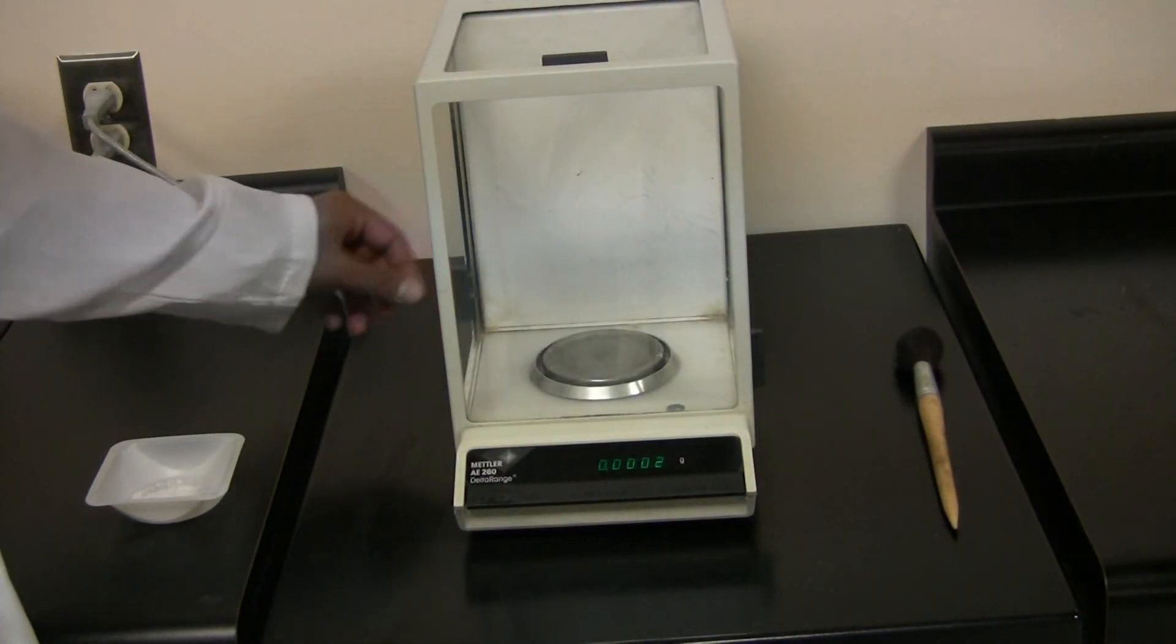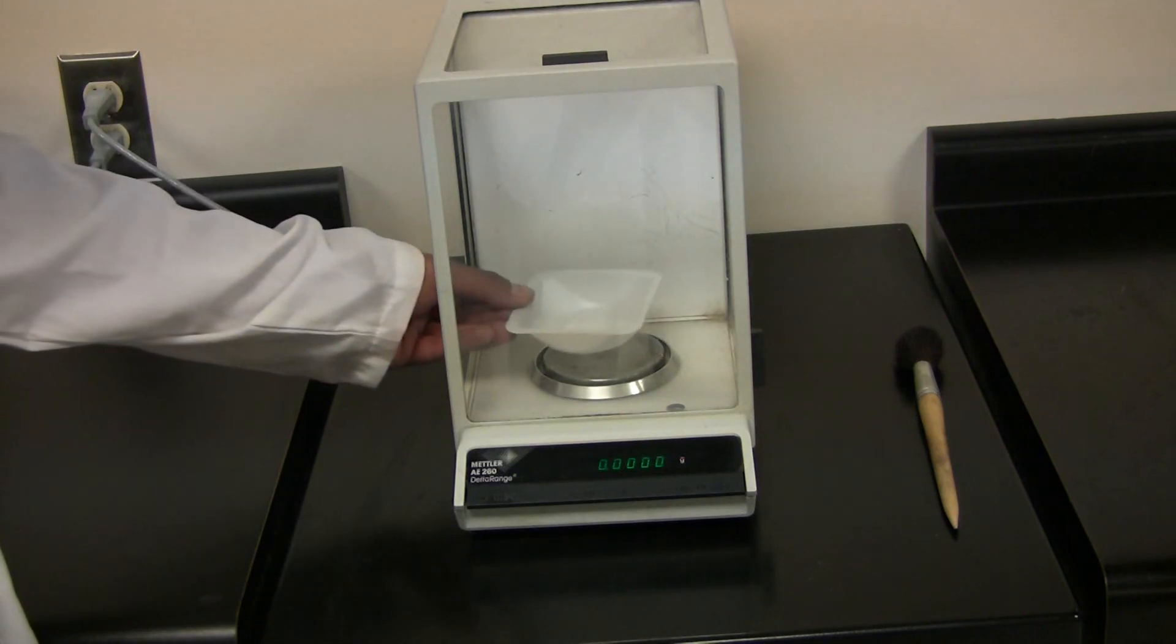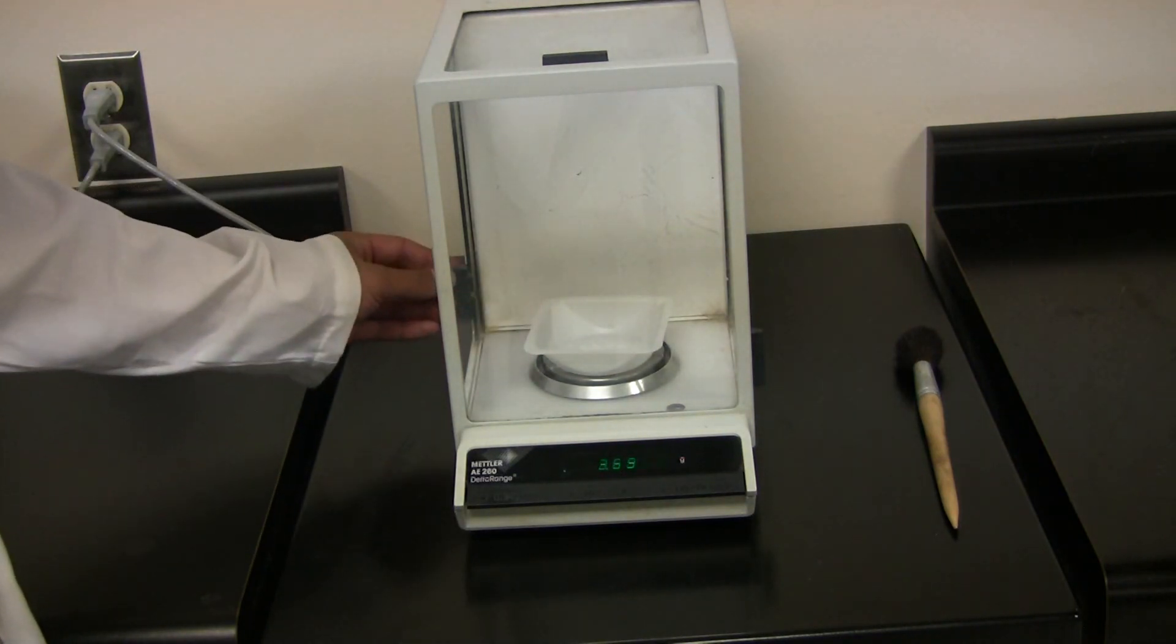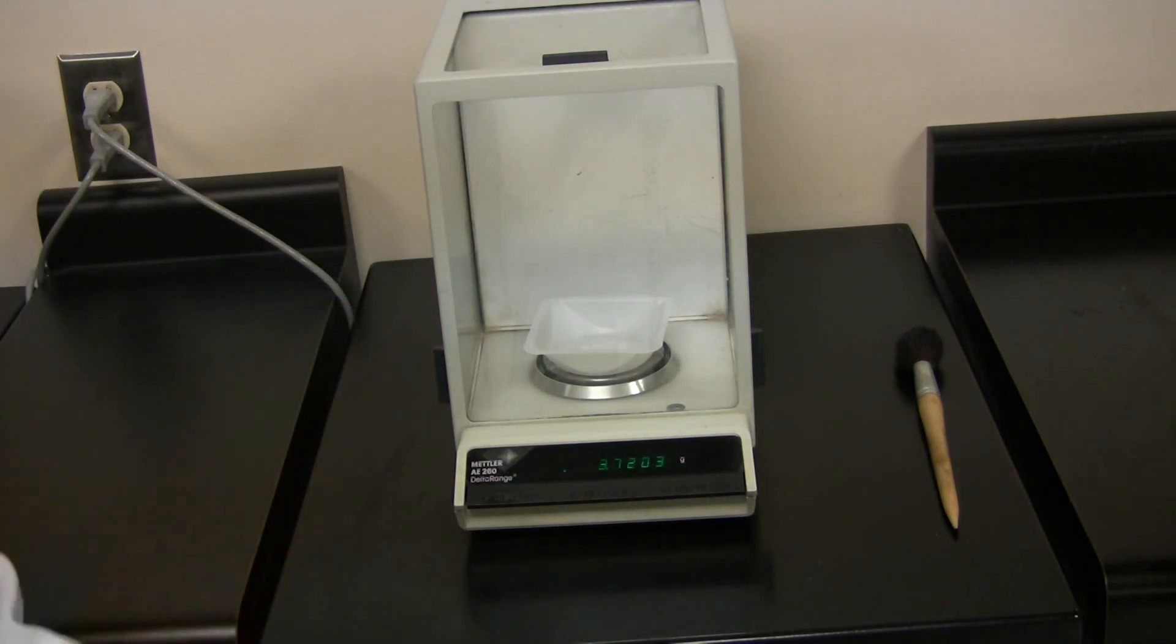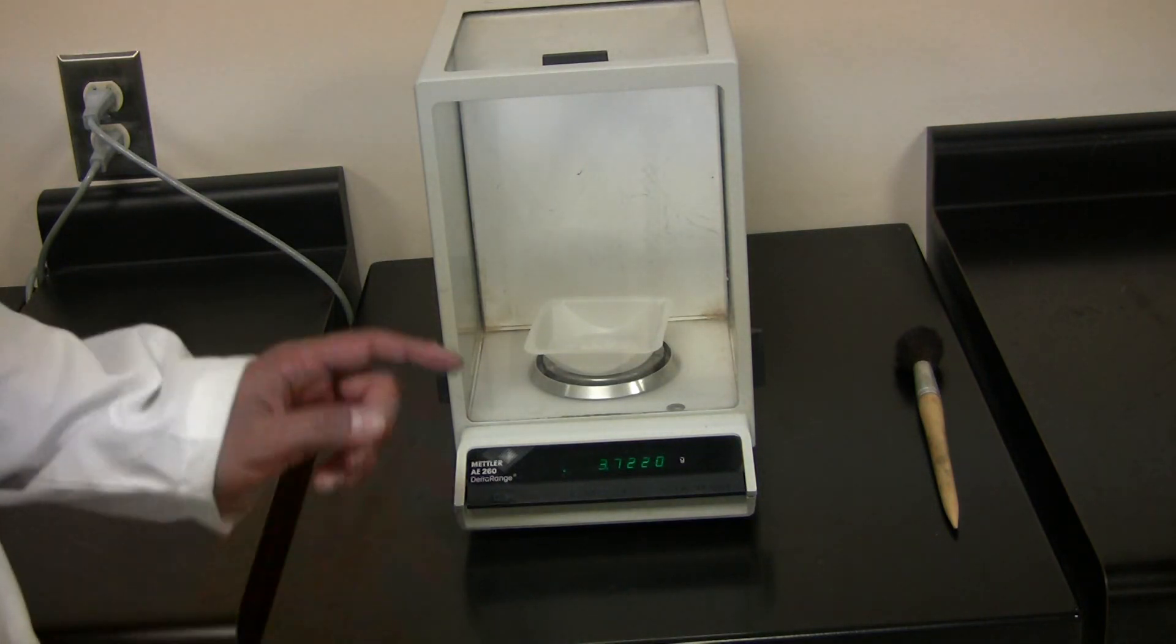Open the analytical balance and place your sample and weigh boat inside. Make sure all the doors on the analytical balance are closed. Once it has settled, make sure to record this value.